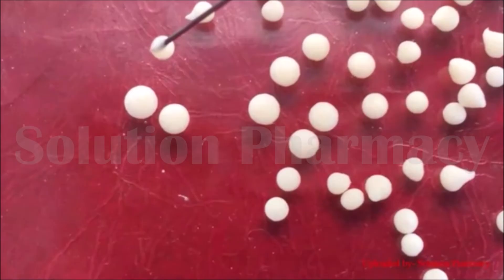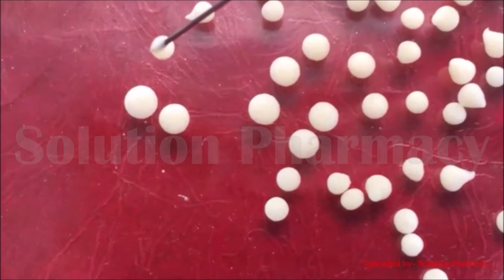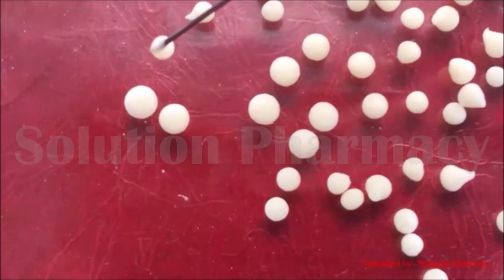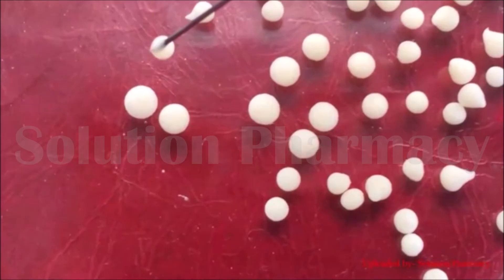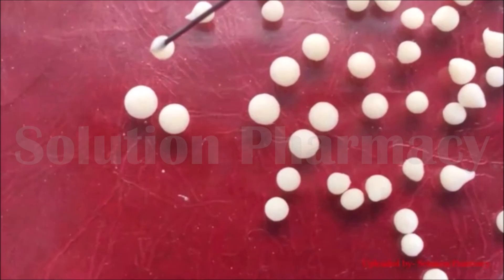Because calcium alginate gel formation takes place under extremely mild conditions, entrapment in the alginate matrix is very suitable for the immobilization of enzymes, drugs, cells, and proteins. Increasing the concentration of the alginate solution results in more tightly cross-linked gel formation.